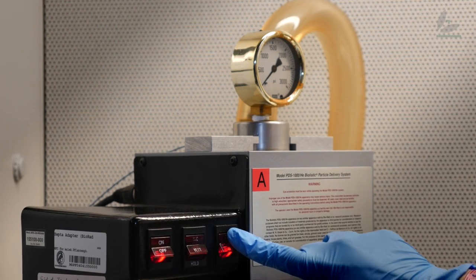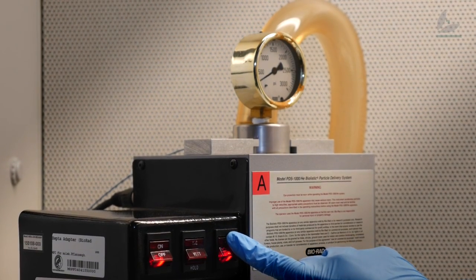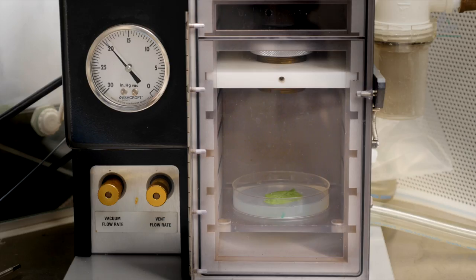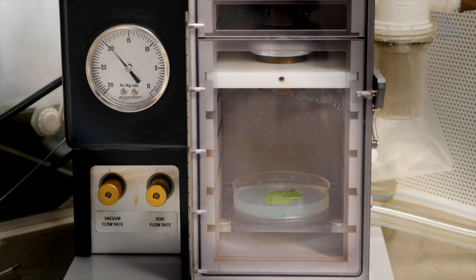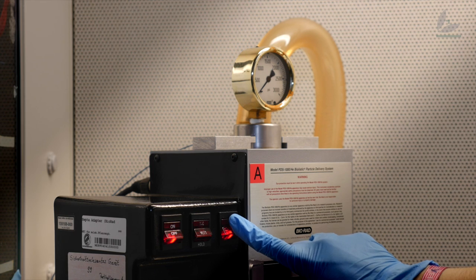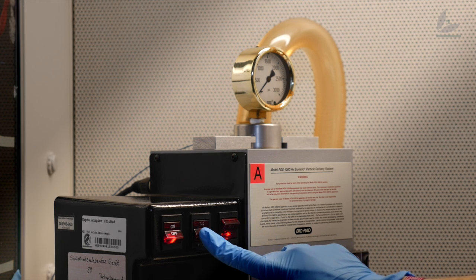So now I'm going to build the pressure — and that's it. I really hope it worked.